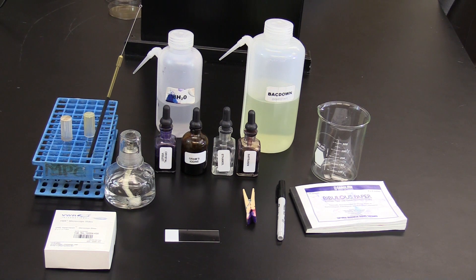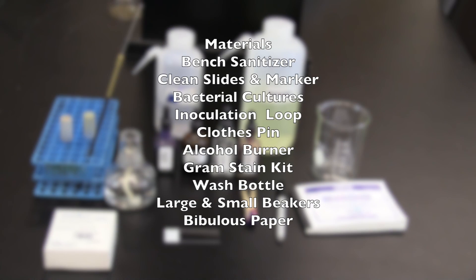The gram stain is a simple microbiology technique used to differentiate between gram positive and gram negative bacteria based on how cells stain. For the gram stain, you will need the materials listed here.